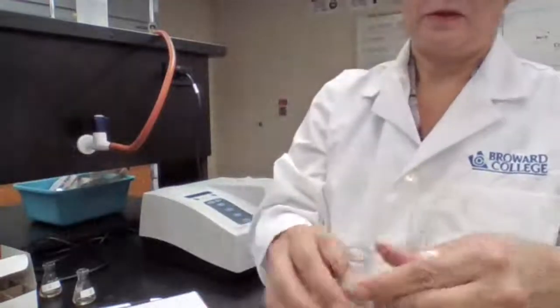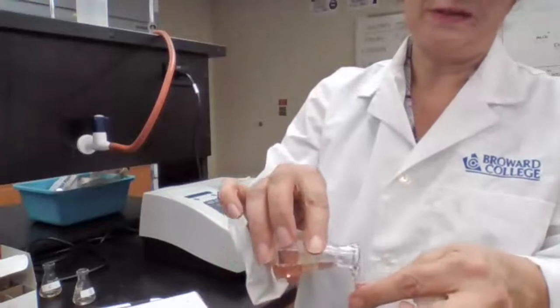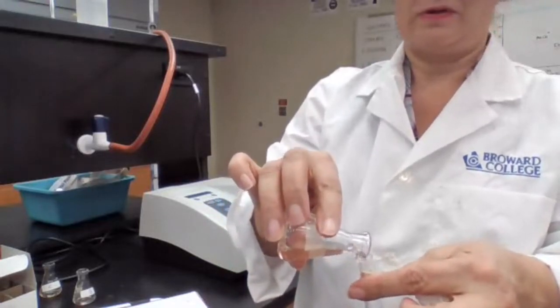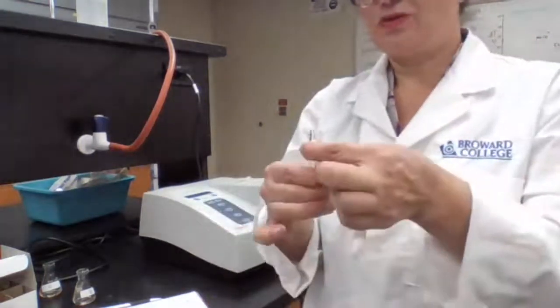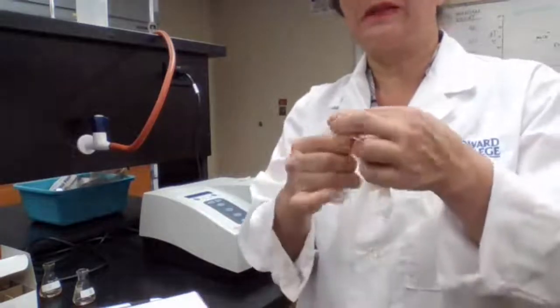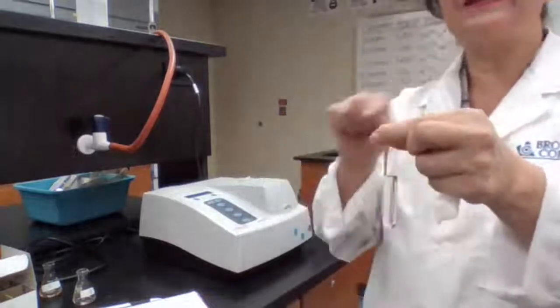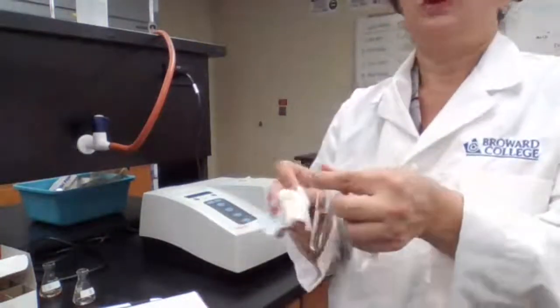So I'm going to start getting ready. If the sample is in the test tube or is in the flask, it should have the same time for intensity of the color, basically. So it's okay to pour it into the test tube and wait until 2:07. As long as I don't read it and I wait until 2:07, it should be fine if it's in the flask or in the cuvette.